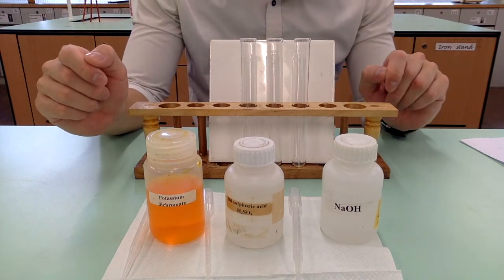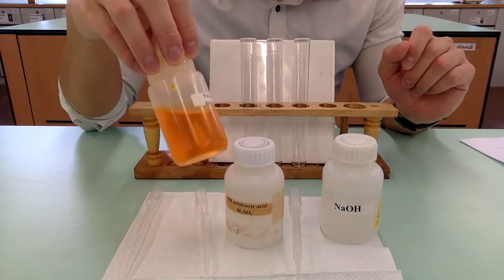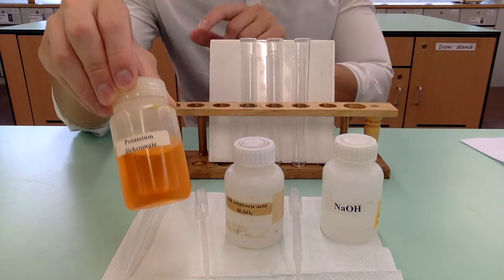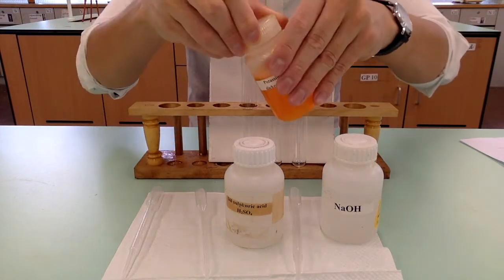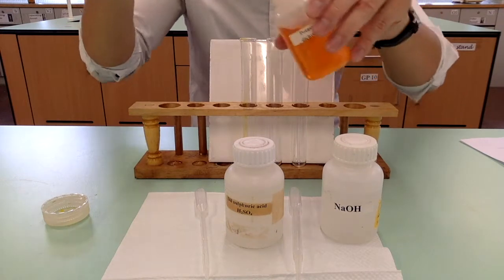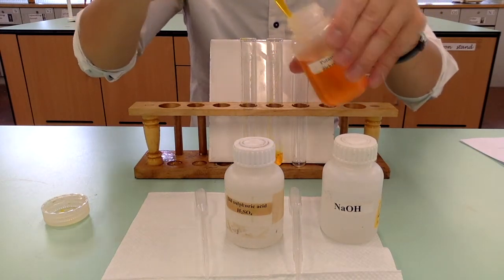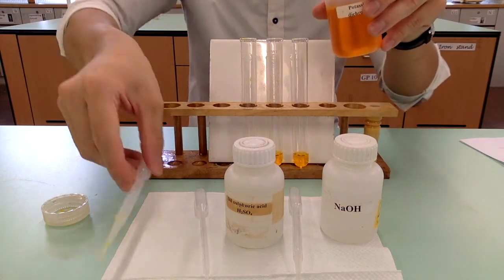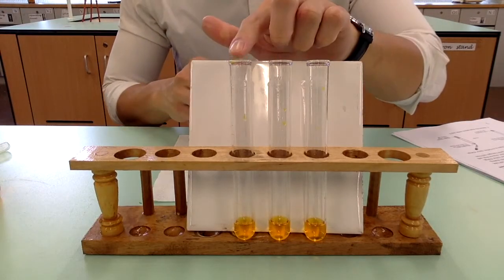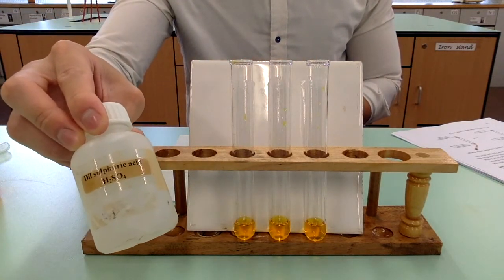We start with three test tubes, adding 2 cm³ of potassium dichromate solution into each. For convenience, I will simply add one pump each. To the first test tube, I am going to add dilute sulfuric acid drop by drop.